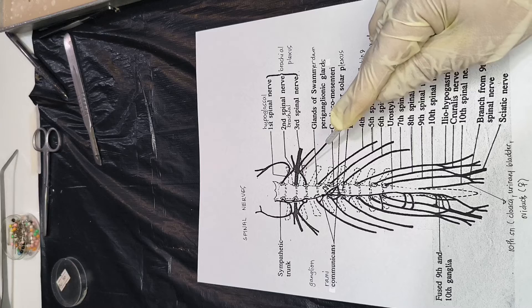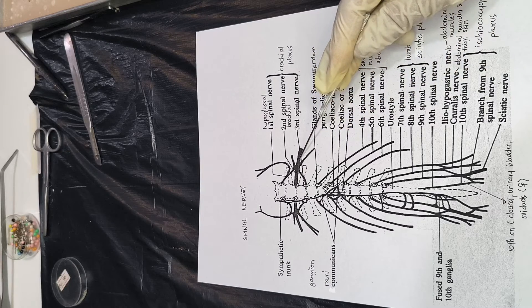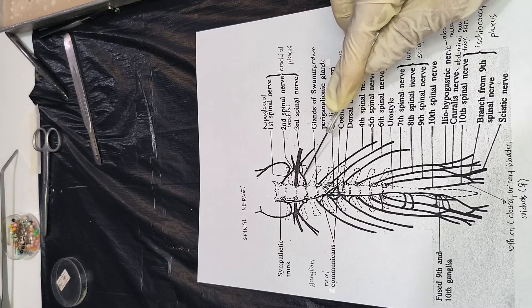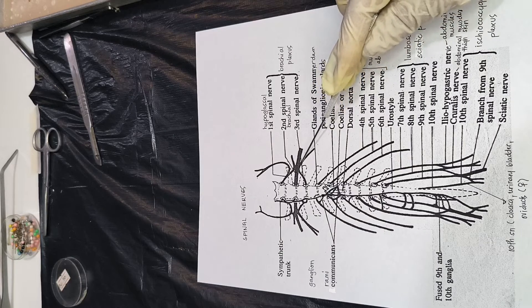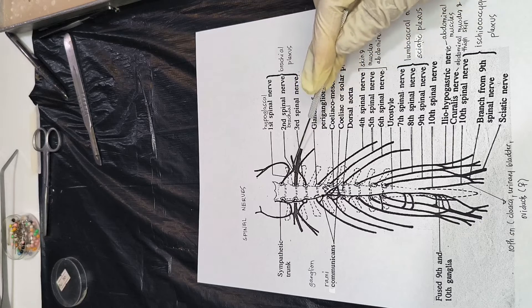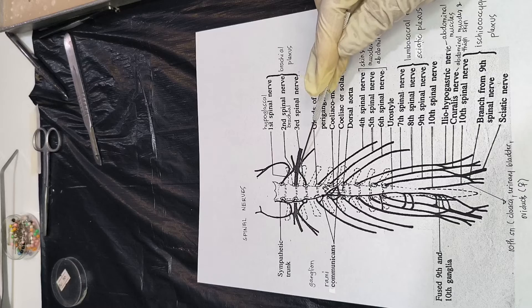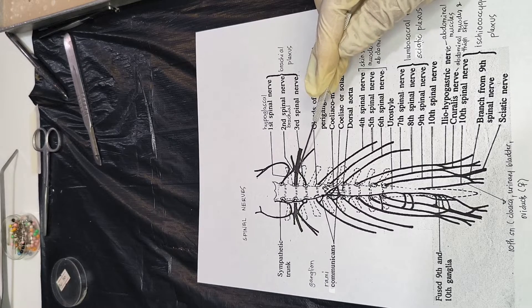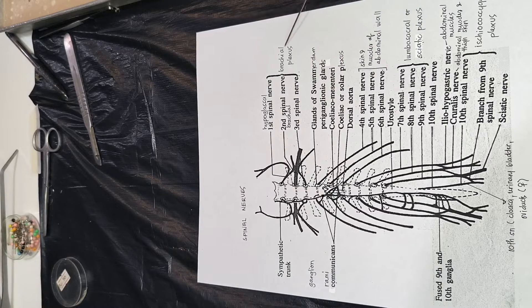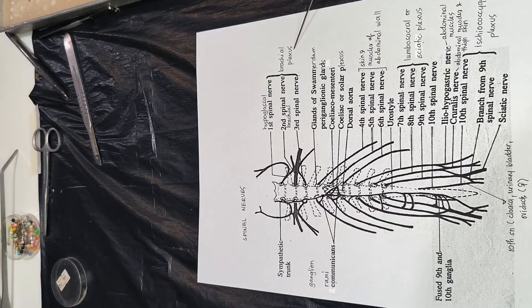Then we have the second spinal nerve — the brachial nerve — innervating the arm. And the third spinal nerve innervates the shoulder and the arm. The first, second, and third form a network or interconnection called the brachial plexus, which innervates the shoulder and the arm.